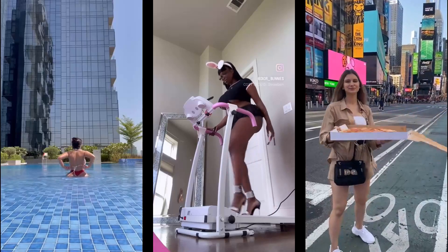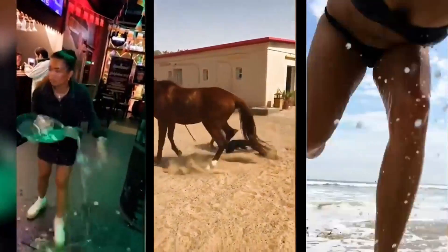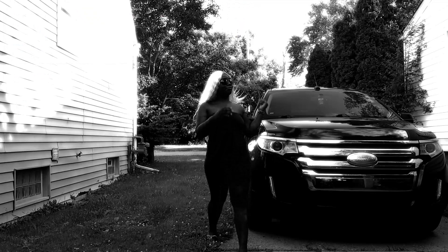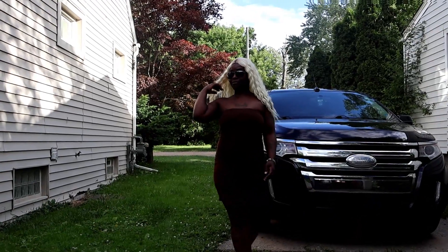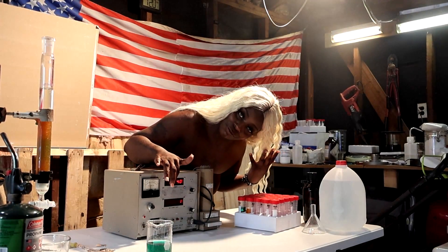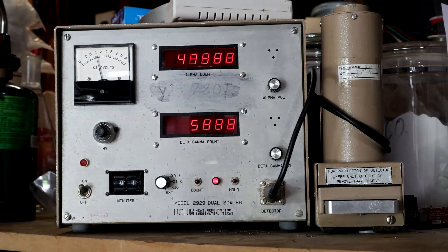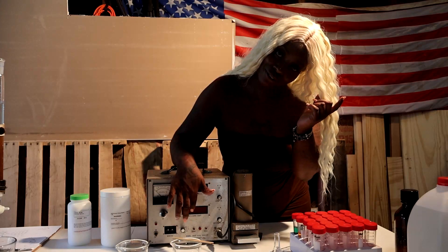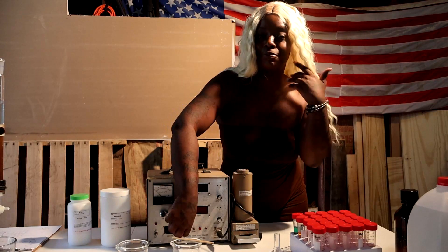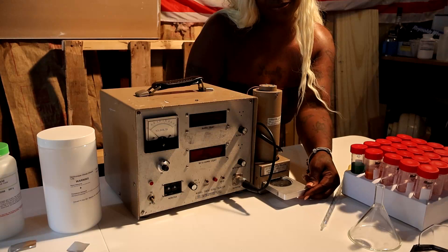To please the algorithm and because sex videos get a lot of traffic, I was going to do this demonstration naked — but because 95% of you are younger men, I asked this lab assistant to demonstrate for me. Yes, science can also be sexy. This is the Ludlum 2929 counter. The total gross alpha is shown here, and both beta and gamma radiations are displayed here. The count time can be selected for measurement consistency with this knob. The sample is introduced in this sliding door and locked in place.